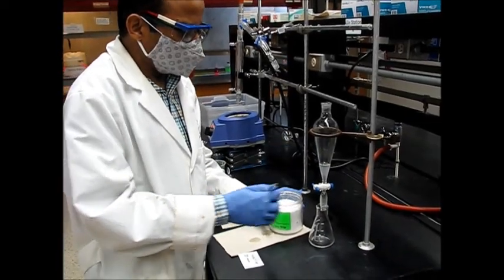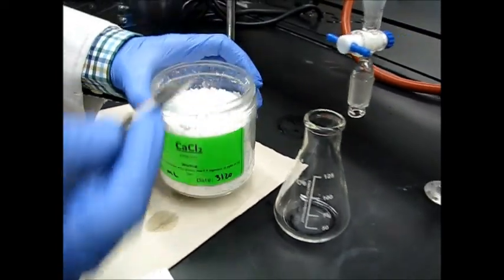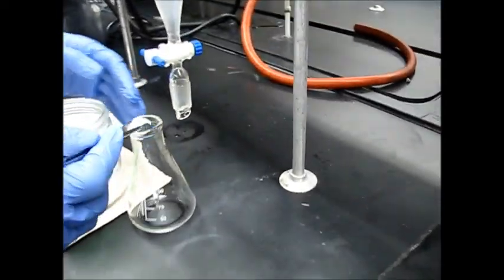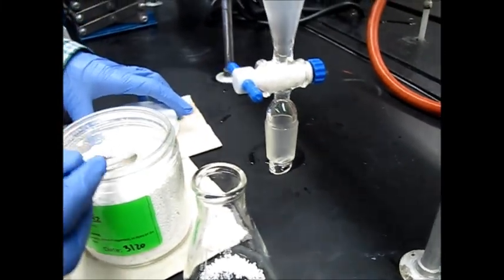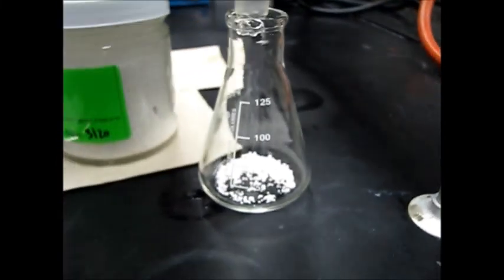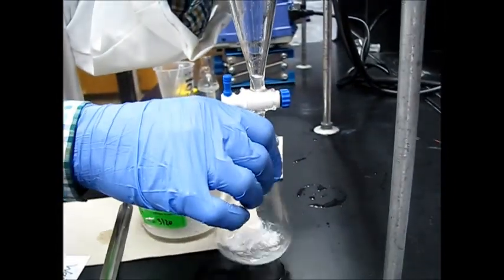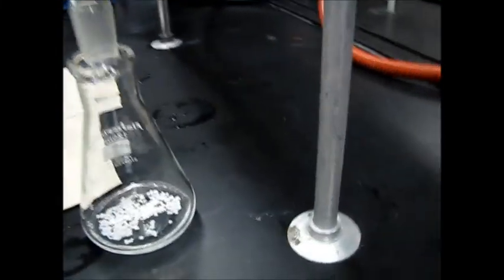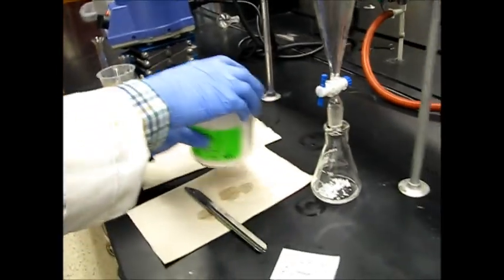The aqueous waste goes into the aqueous waste container, and we need to clean the round-bottom flask. Now it's time to dry your organic layer. We have calcium chloride, which is a dehydrating agent — take a small scoop of this dehydrating agent and add it to your collected product. It will absorb all the moisture. Now you have to wait for 10 minutes while you can clean all your other glasswares.